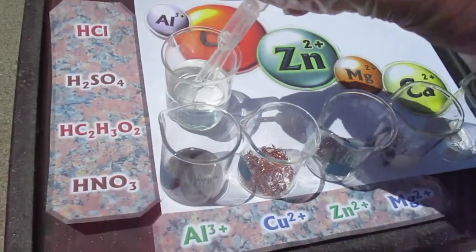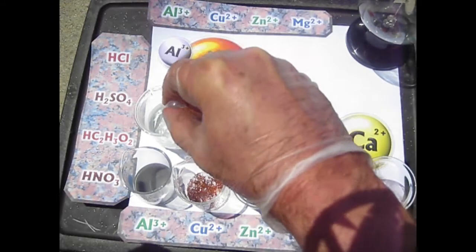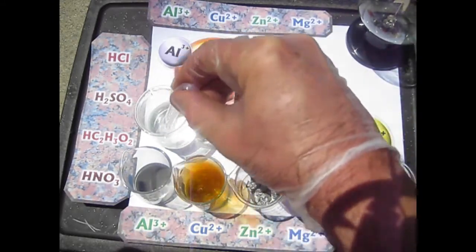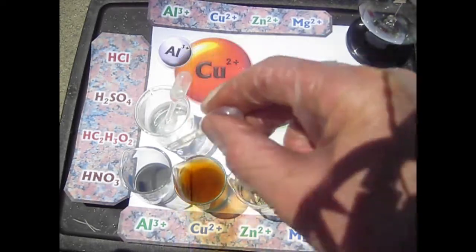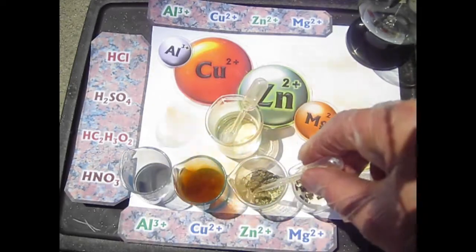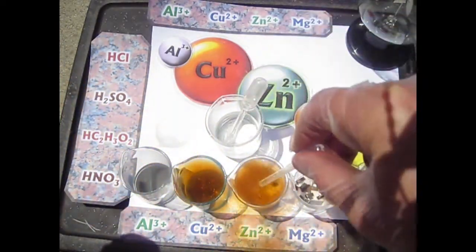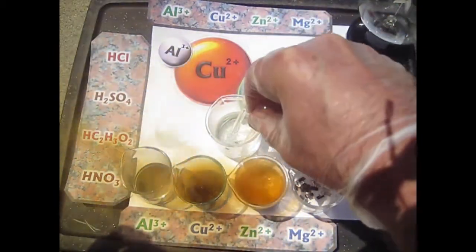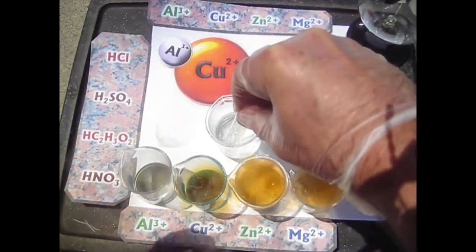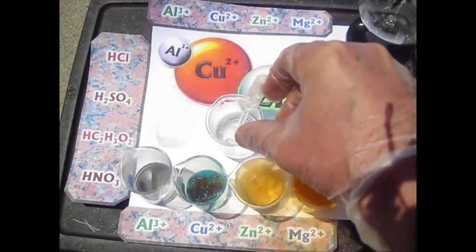1, 2, 3, 4. 1, 2, 3, 4. Over. That's a good reaction. Whoa. 2, 3, 4. 1, 2, 3, 4. Remove this.